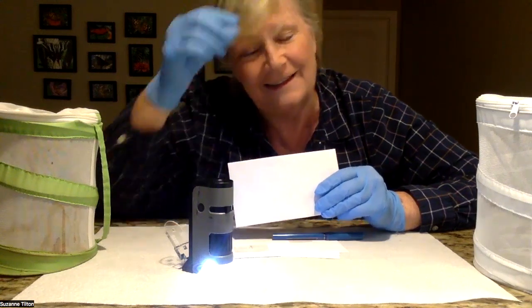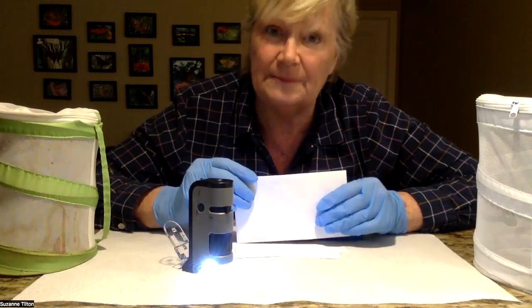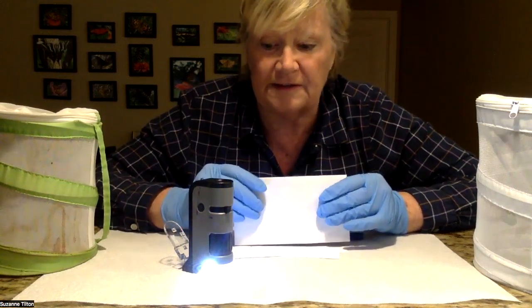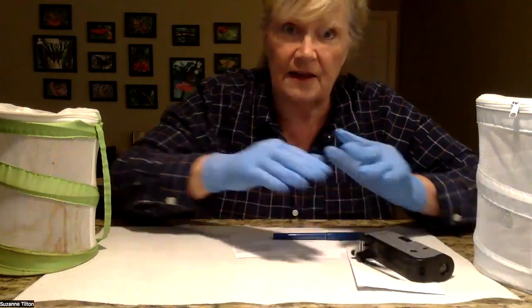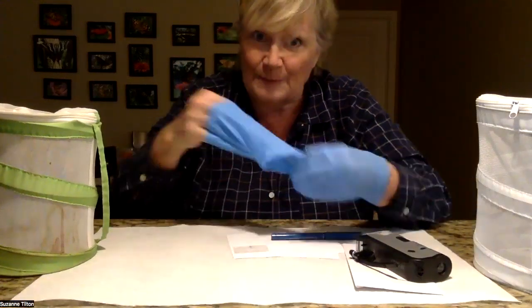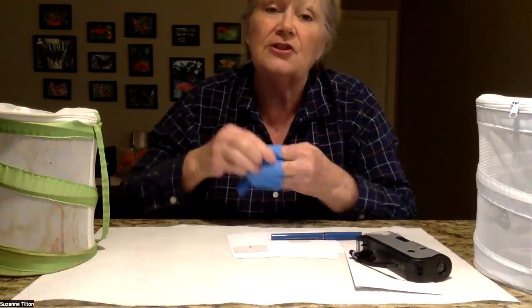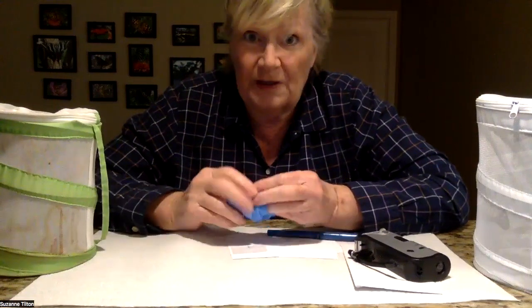I know that sounds cruel, but we don't want to release butterflies that are infected with OE. We want to try and eliminate this because it is harmful to the butterflies. That's a very simple procedure for how I do it. If I do find OE in the butterflies, it's very important that I clean my surface — just like you would at a hospital, remove your gloves inside out, toss them, throw all this away, and wipe down with a bleach solution. Since I don't have OE, I'm not going to worry about that. I hope that helped you understand how to test for OE. Have a great day.